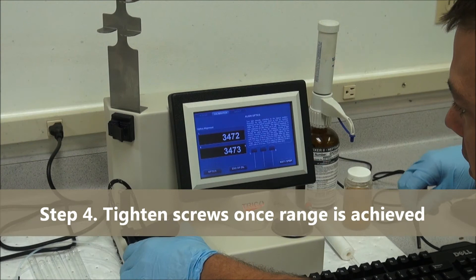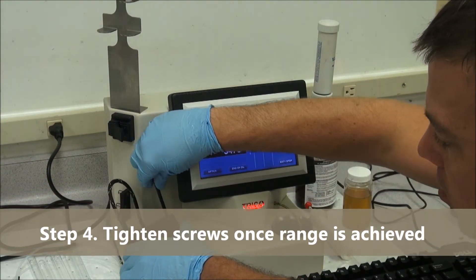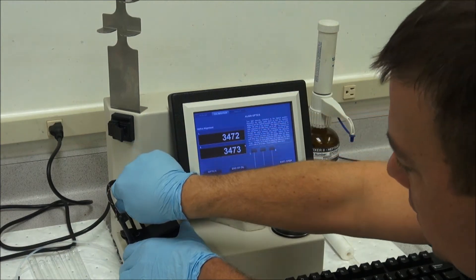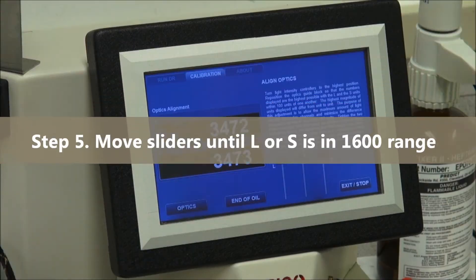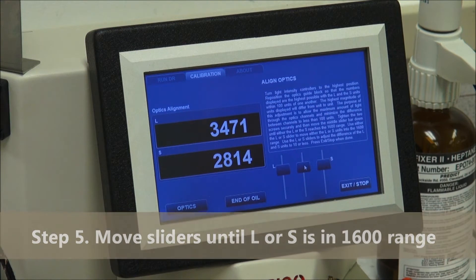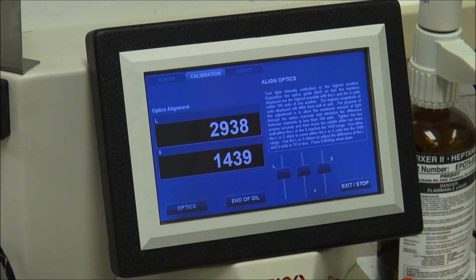Once the numbers are in range, tighten down the allen head screws so that the block stays in place. Next we want to move the slider bar down until the L or the S number is in the 1600 range.